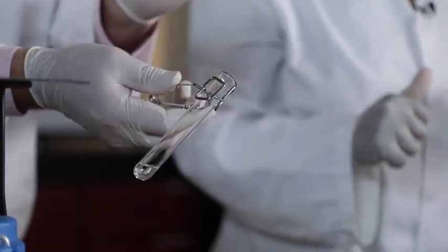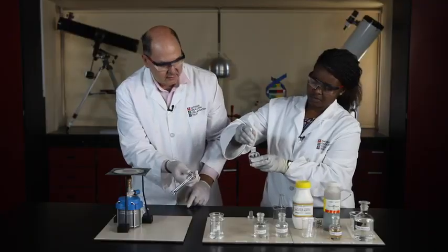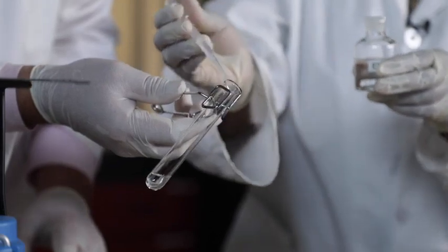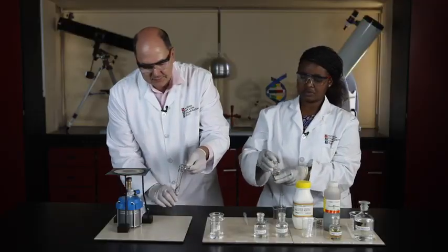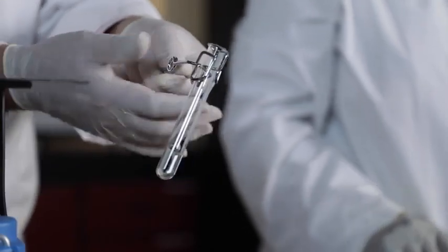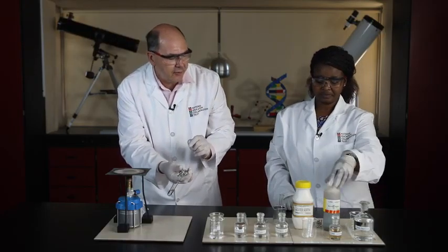Next, we're going to take 20 drops of ethanol. And it's about 2 ml of the ethanol into the test tube, and away we go. Let's swirl it around. There we've got our carboxylic acid and alcohol. We need to add our catalyst. The catalyst is concentrated sulfuric acid.